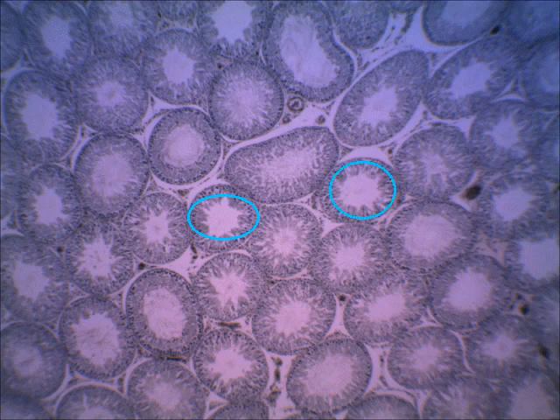So all of these openings that you see are the seminiferous tubules. You see one there. Of course, I didn't circle that just perfectly, but you see several seminiferous tubules. So the arrow is right in the middle of all of these seminiferous tubules. All right, this is where sperm cells are made.